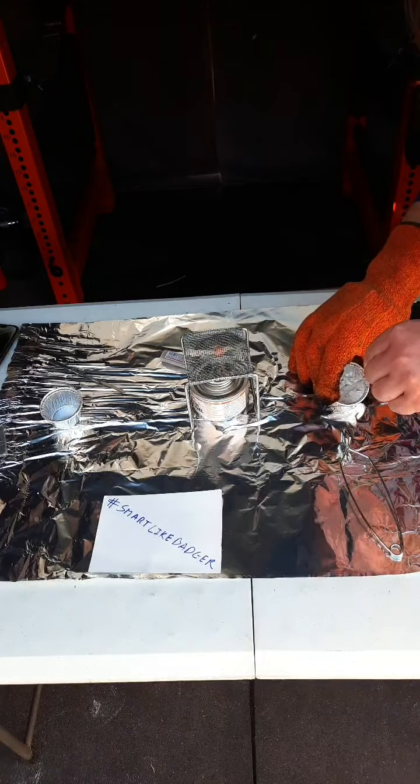Boris will heat. Now what we will do is we will quickly weigh. We are going to do 2 heatings with this experiment. What that means is that right now we are going to weigh it just quickly and then put it back on the heat for another minute or two and then weigh it a second time.